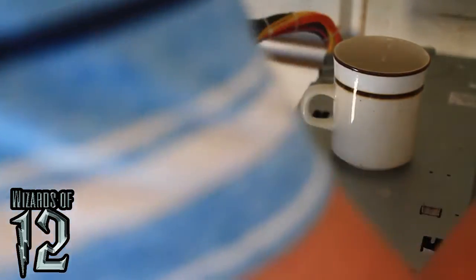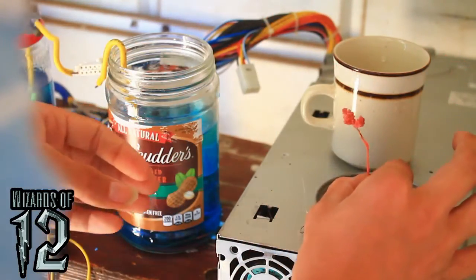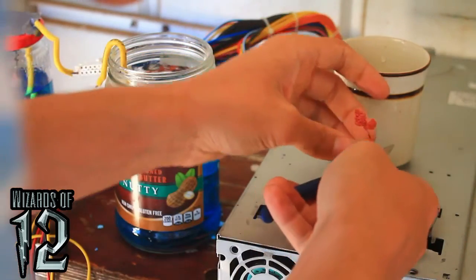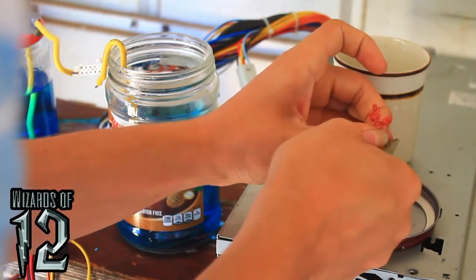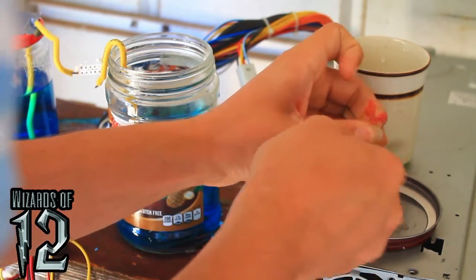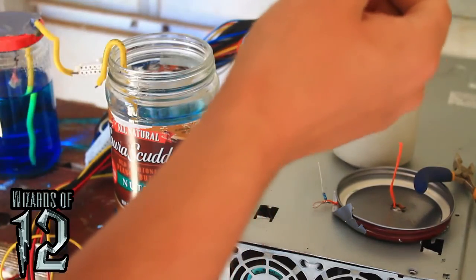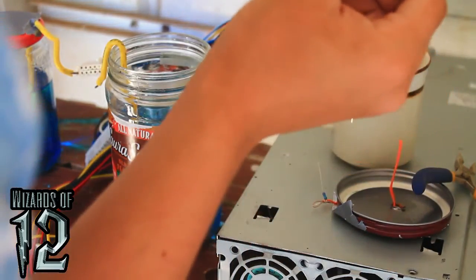This is reminiscent of my 3D printer smell. Okay, got sticky hairspray on my hands now.